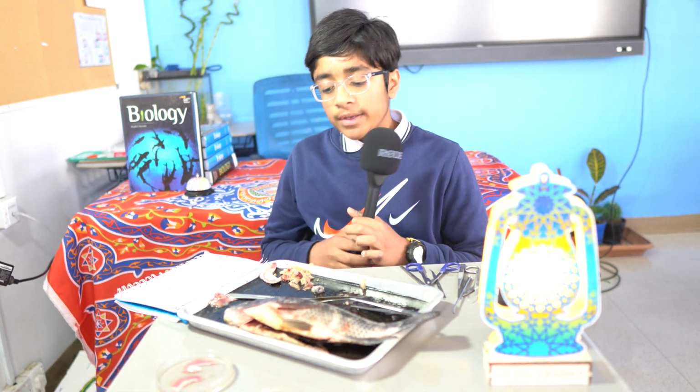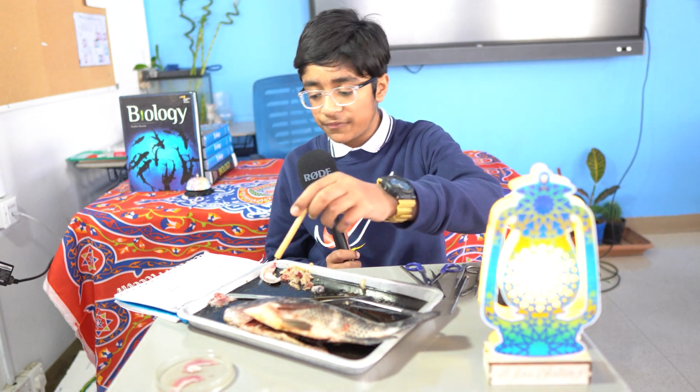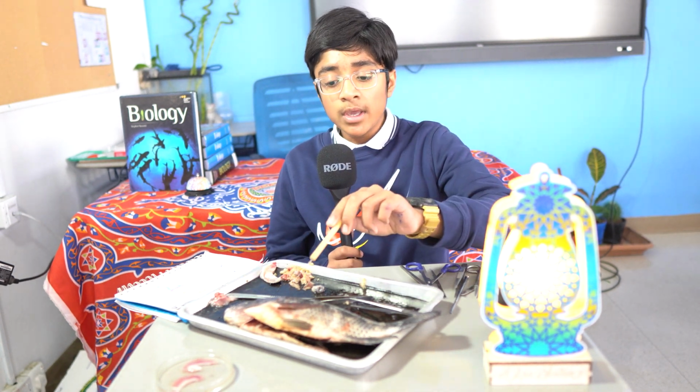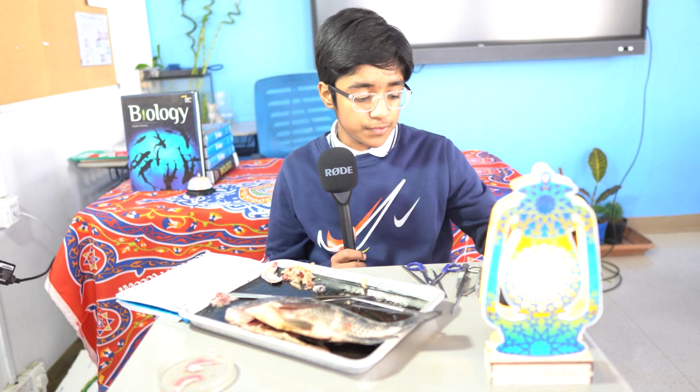Now, the alimentary canal, or the main one of a tilapia fish, begins with the mouth opening and moves on like any human with an esophagus that ends in a stomach. And from there it goes on to a small intestine and a large intestine and comes out to the anus.